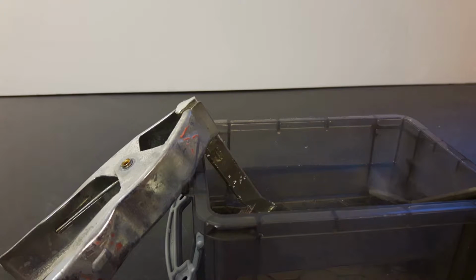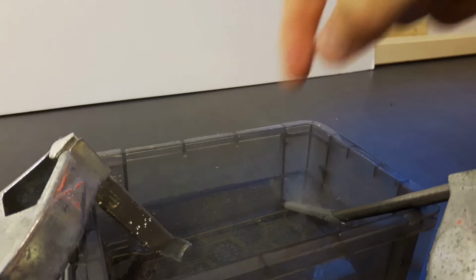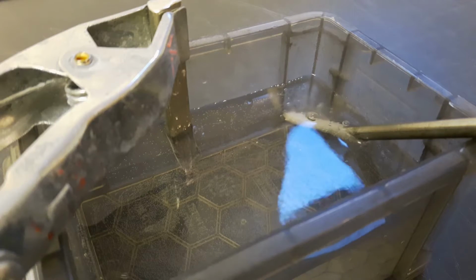Amazing. Immediately, the current starts to flow. And hydrogen is produced. I don't think it's very important if you use a specific voltage. I just turn up the voltage to make the reaction going a bit faster. But at the moment everything seems to be perfect because only hydrogen is produced and we don't electrorefine tin.